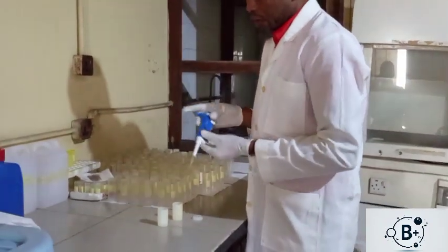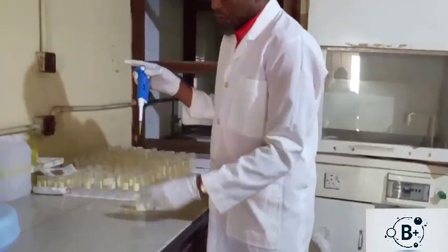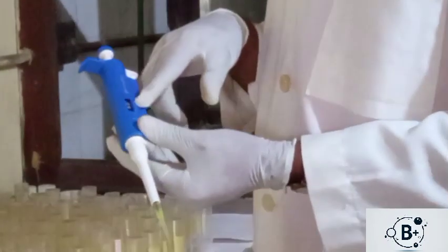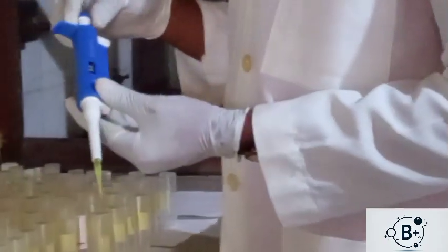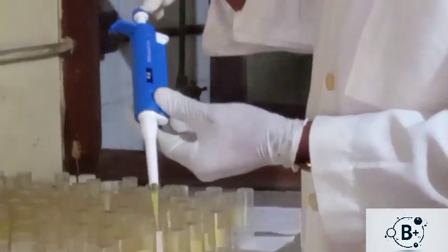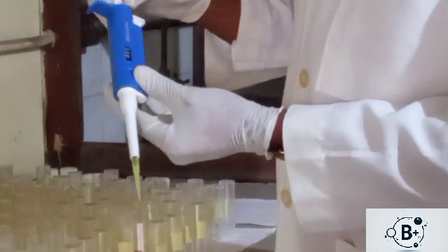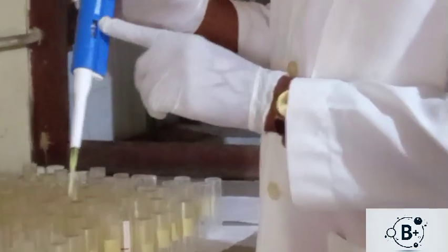Then on the long run, I want to take the second measurement now. I will now adjust it again. You remember I said I want to take 67 microliters. So I've taken 50. Now I want to take 17. So to make it 67, I will adjust this now back, using the adjustment dial now. I will adjust it to 17 microliters. So this is 17 microliter.